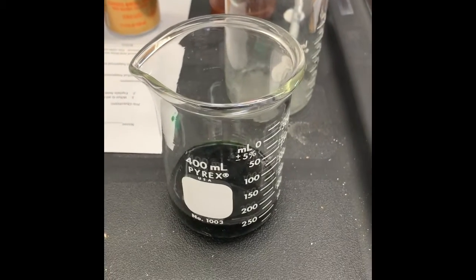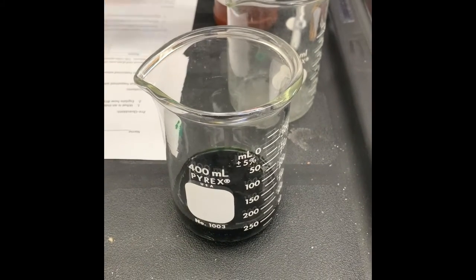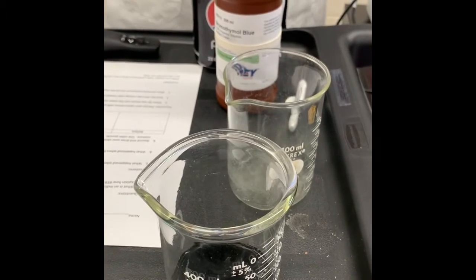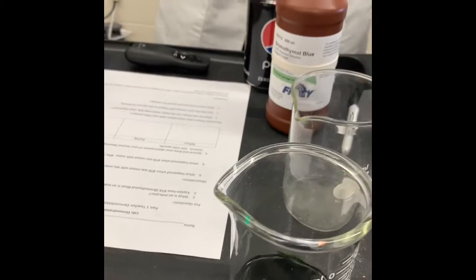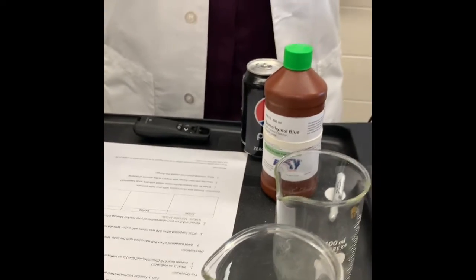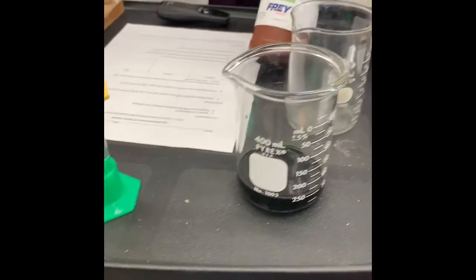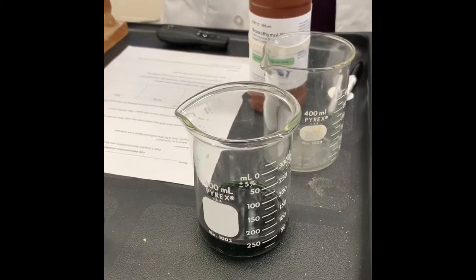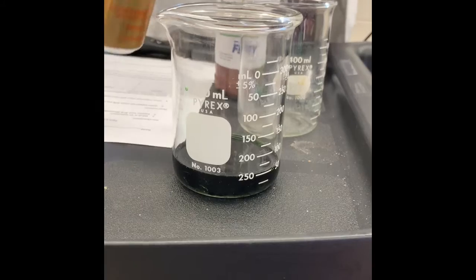What do you think would happen if I poured a little bit of this Pepsi? Well, this is kind of dark, so we'll take a lighter color. Let's see if we had some of this carbonated water. What do you think would happen? Let's take a moment with your elbow partners and just tell your neighbor what you think is going to happen. If we said the BTB is an acid indicator, it's blue, it's supposed to change colors in the presence of an acid. Once I add this in here, let's see what happens. Let's look.